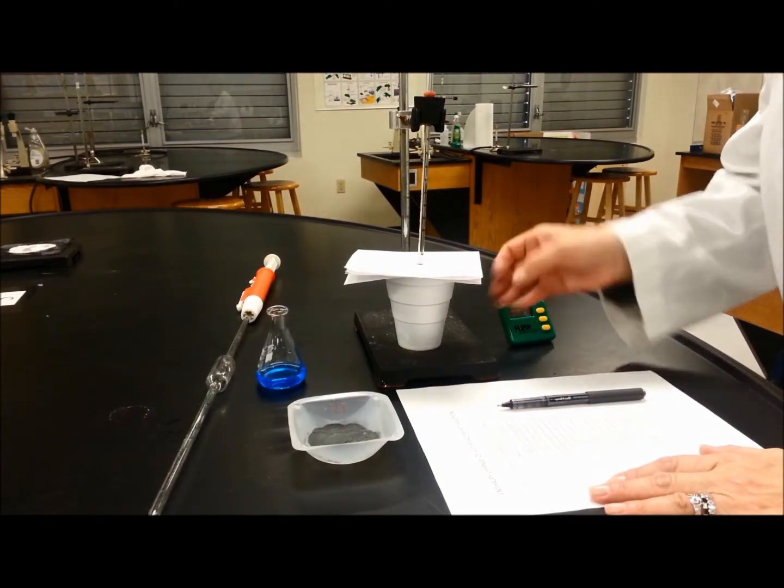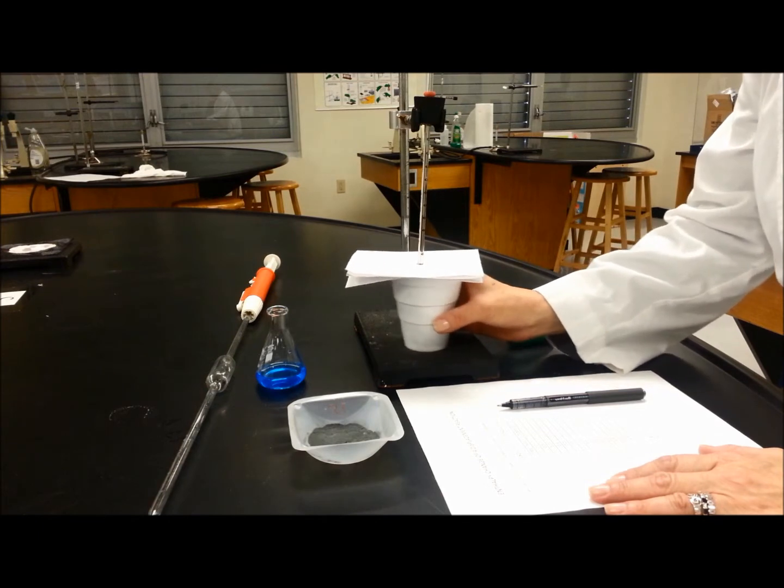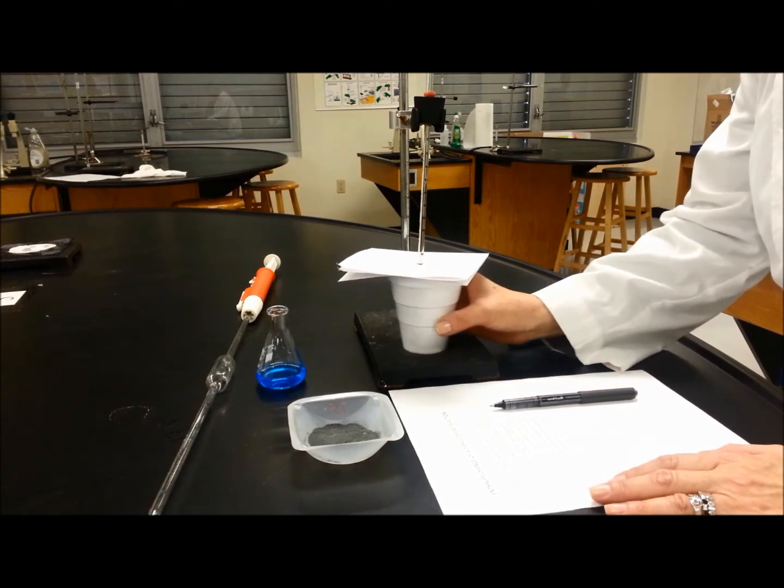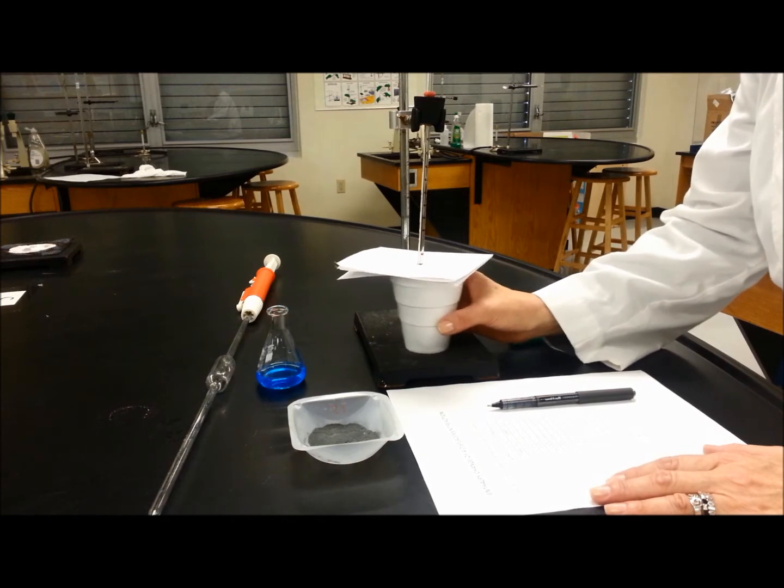All the time when you are recording, you need to swirl so the temperature is evenly distributed in the liquid.